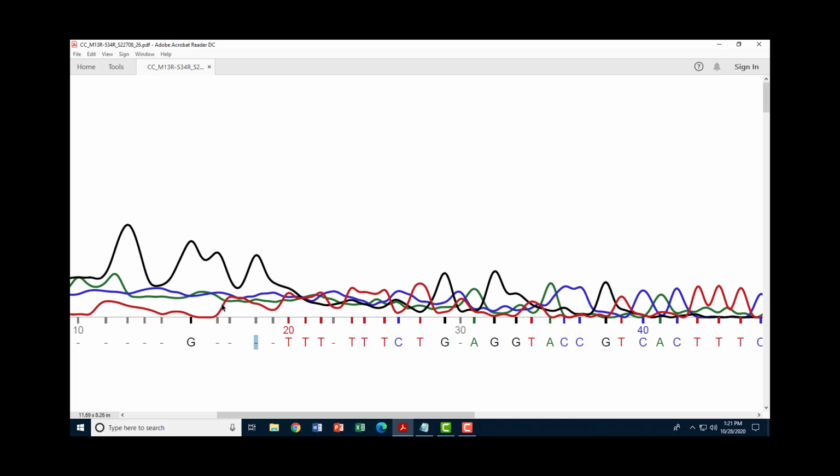That's thymine. Now because this is on the upslope, this is definitely on the downslope, and these are flat, I would give this a little more weight, and I might call this position thymine. Here, this definitely wouldn't be thymine. We have pretty flat signals here, one on the downslope, one flat, but we have what looks like a peak. So I would probably call this position guanine.